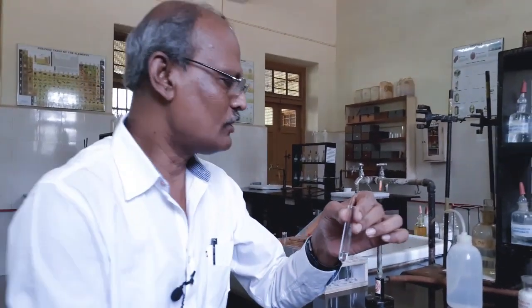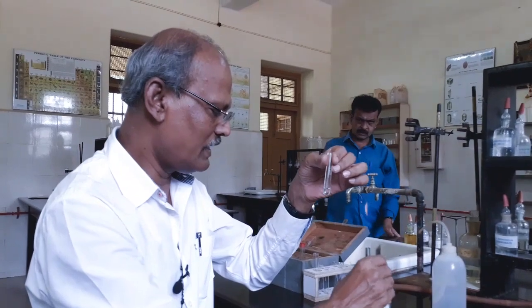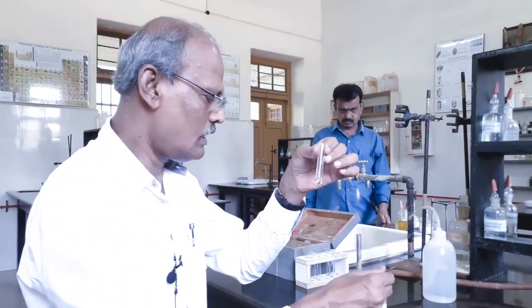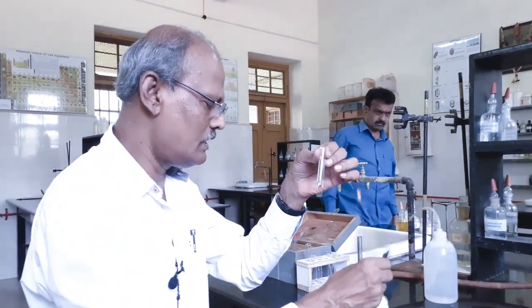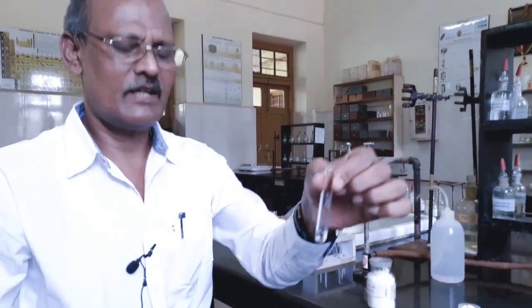Okay, now I proceed to the analysis of fourth group basic radical. Fourth group basic radical group reagents are ammonium chloride, ammonium hydroxide and hydrogen sulfide. Okay, now to the centrifugate.